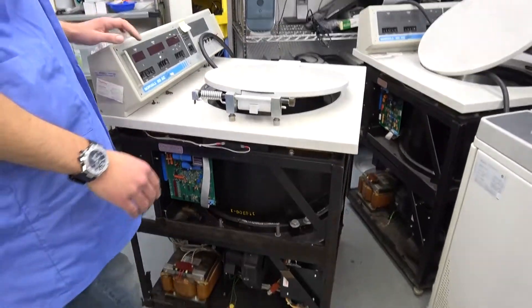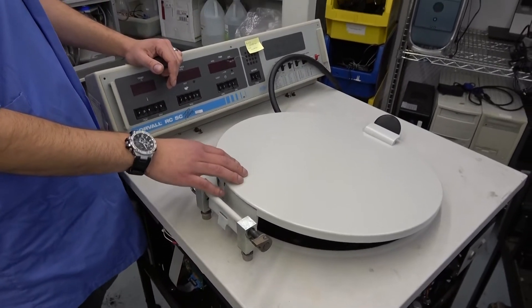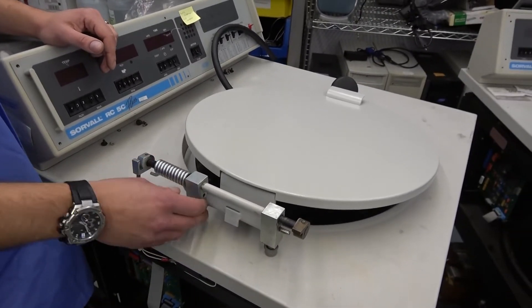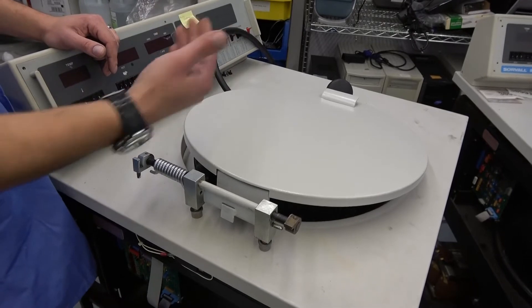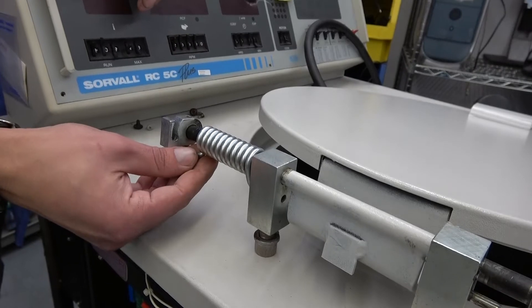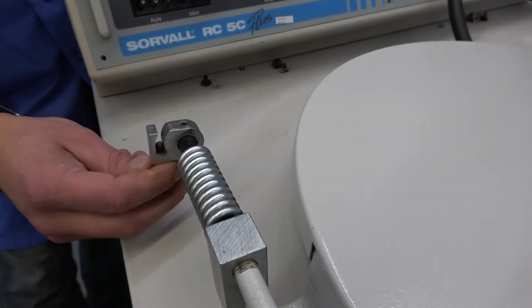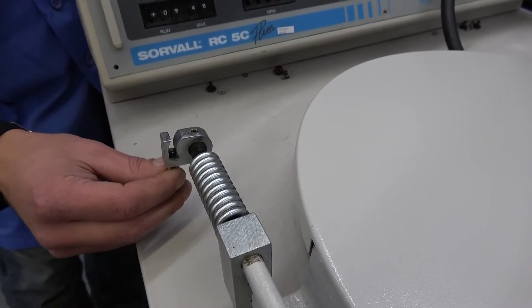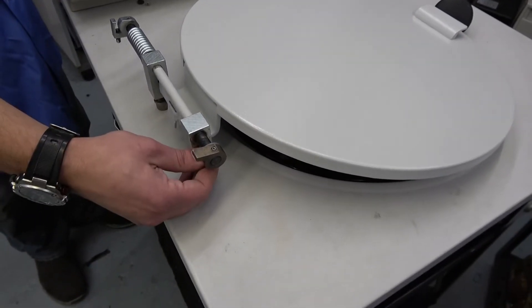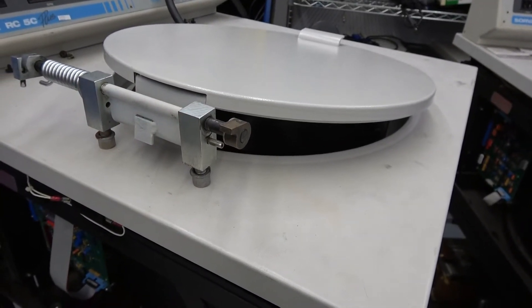Coming back up — we had to take the door off of this one. This door was damaged, so we had to have it painted and filled in. You can see what your door would look like: your spring that actually does the springing action of the door, and this is adjustable with this little set screw. The further you push this in, the more springing action you get when the door swings open. On the other side, this is just your stop — it comes down and hits the pin. If this pin's not in, this part of the door will slam against the top of the deck.